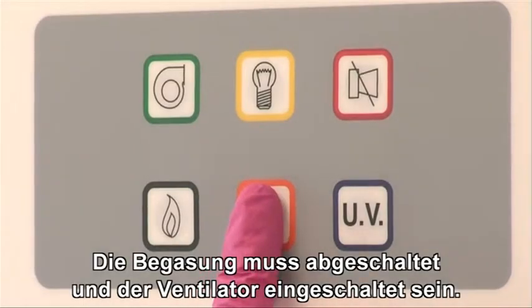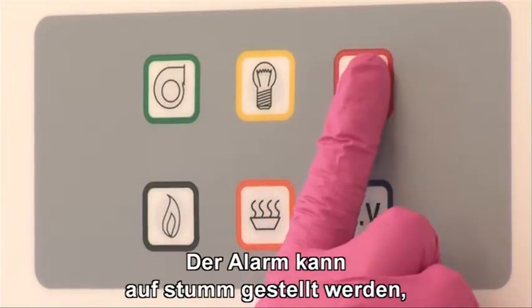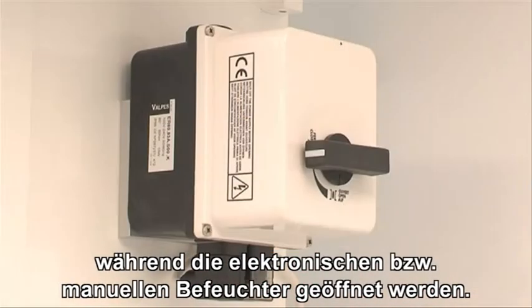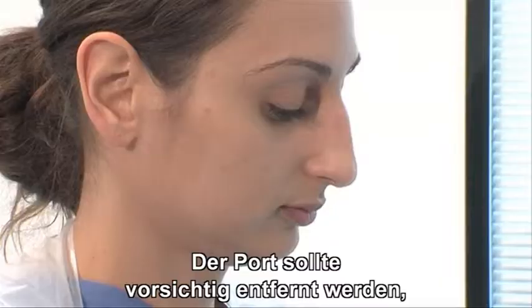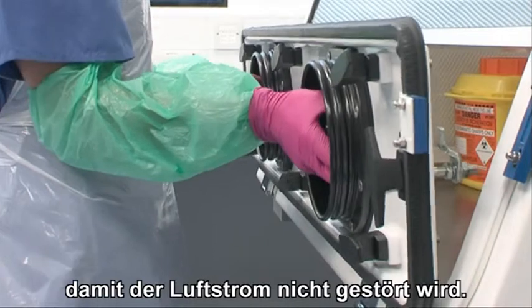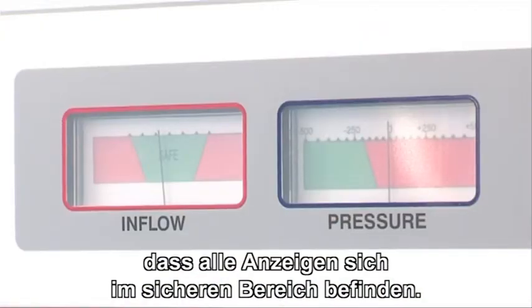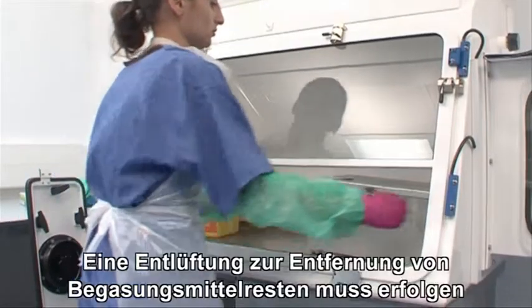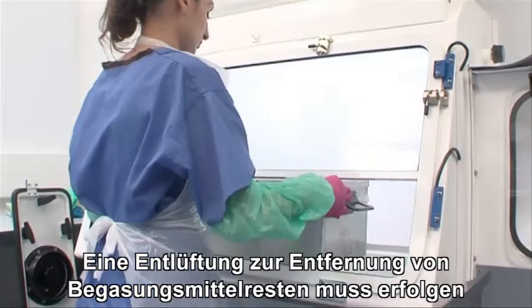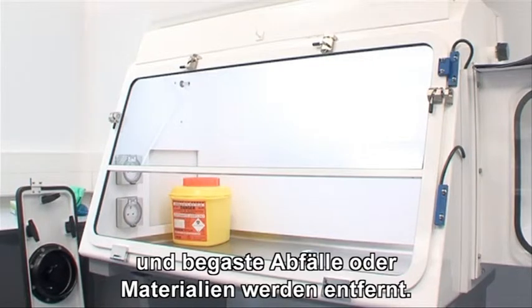The fumigator should be turned off and the fan must be turned on. The alarm can be muted while the electronic or manual dampeners are opened. The night door or port can then be removed carefully to make sure the airflow is not disrupted. The cabinet dials should be checked to make sure they are in the correct and safe zone for use. The cabinet should be vented of fumigant, and any fumigated waste or equipment must be removed.